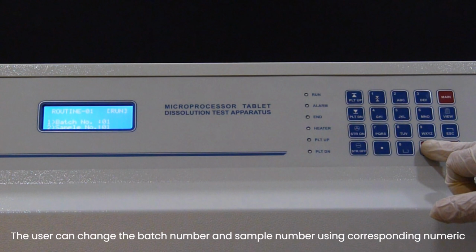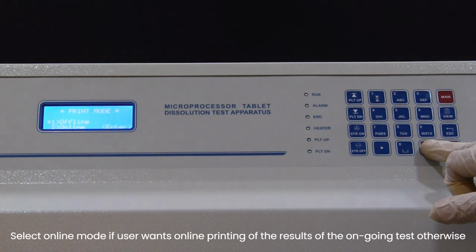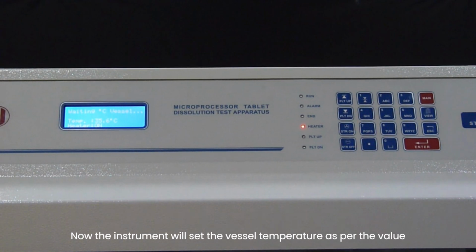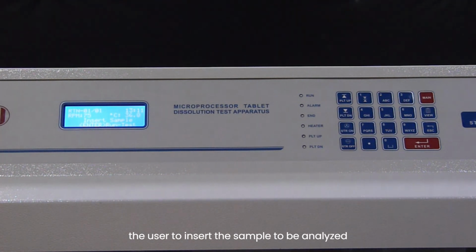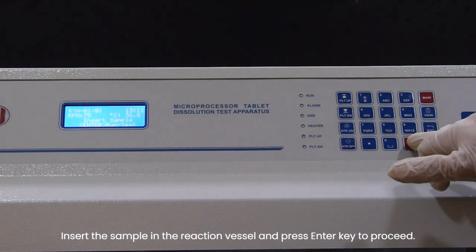The user can change the batch number and sample number using corresponding numeric keys followed by the Enter key. Select online mode if user wants online printing of the results of the ongoing test, otherwise select offline printing. Now the instrument will set the vessel temperature as per the value in the set temperature parameter of setup selected for current analysis. When the required vessel temperature is reached, the instrument will prompt the user to insert the sample to be analyzed. Insert the sample in the reaction vessel and press Enter key to proceed.